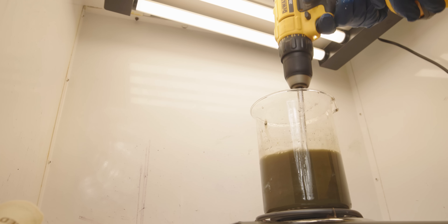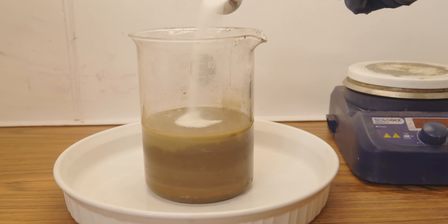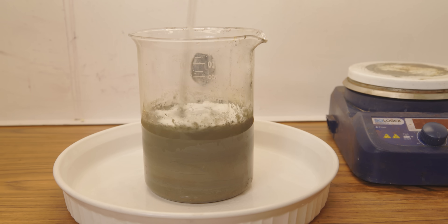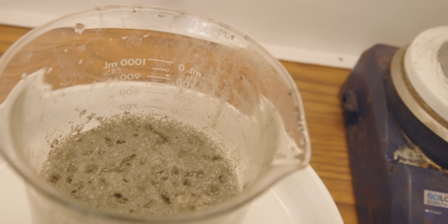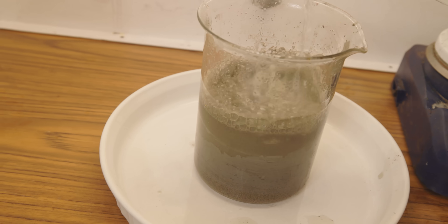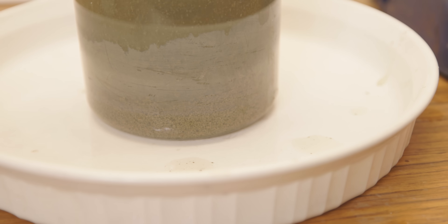Now that the silver chloride has been converted to silver oxide, the last major reaction is to convert that silver oxide into pure silver powder. This is done by simply adding glucose — yes, that's right, just add sugar. Slowly pouring the sugar into the beaker, we can see that it's having a hard time penetrating the surface and dissolving. I gave it some encouragement with the stir rod and added a bit more sugar to try to stimulate a reaction. I'm realizing that the reaction is trying to happen, but the contents of the beaker are just too dense. Things got fun when I decided to add a bit of water — it was like a volcano ready to erupt. Adding water gave the reaction permission to breathe. I watched in glee as pure silver sank to the bottom, and silver flashing appeared on the wall of the beaker.